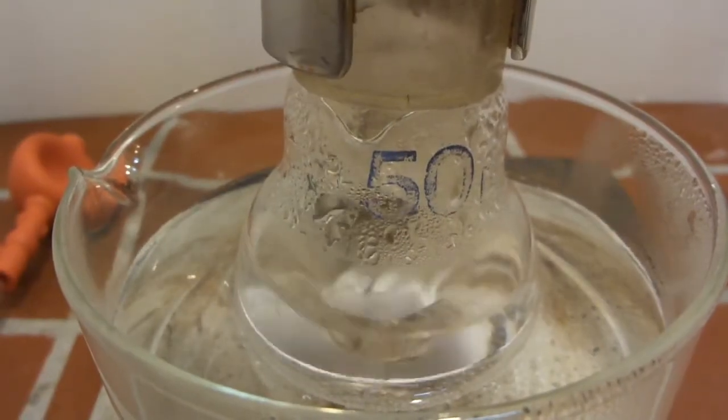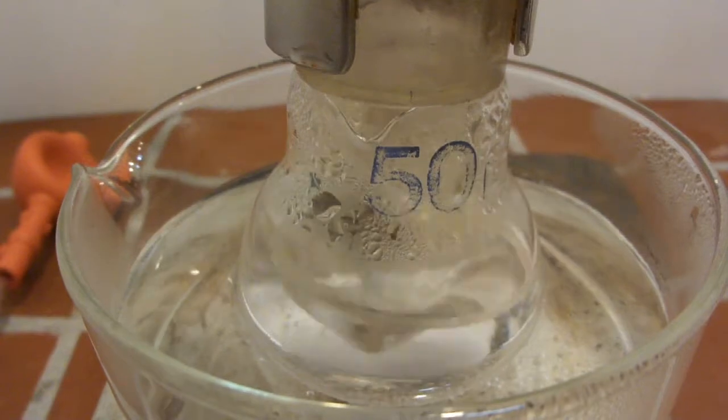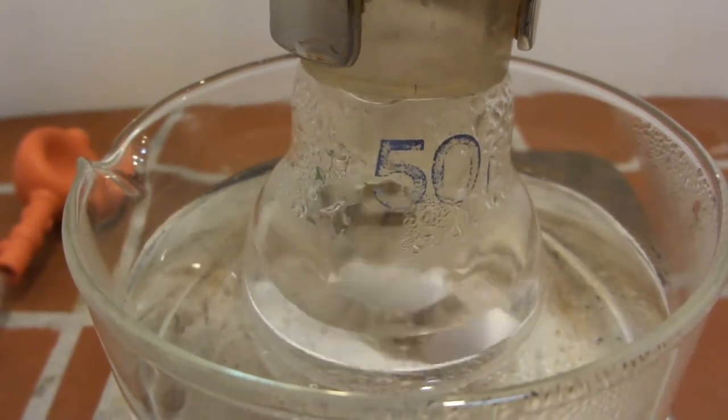In this video, we are going to prepare toluene and take a look at aromatic sulfonation and desulfonation reactions.